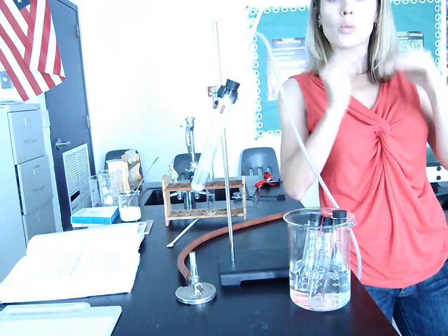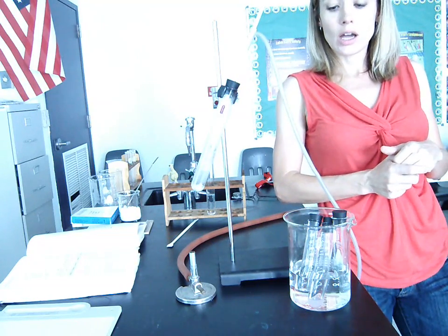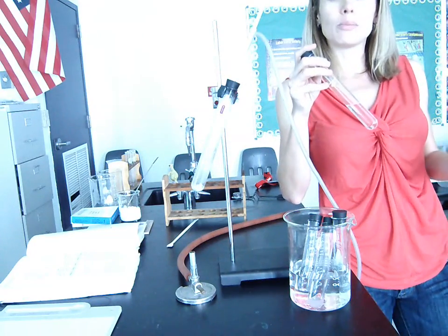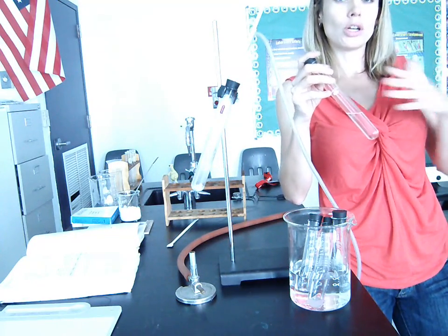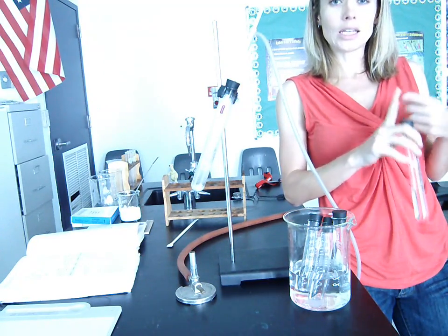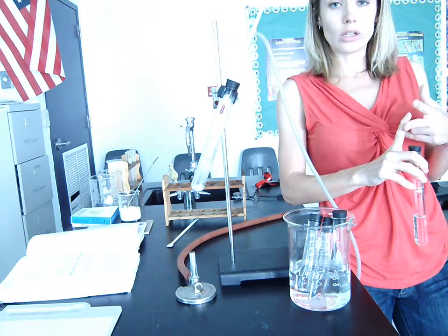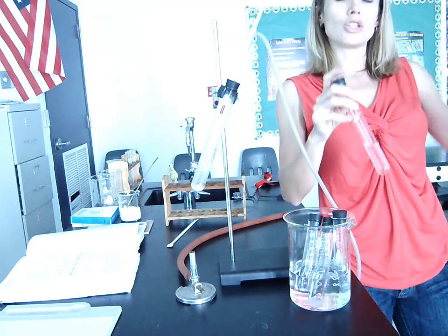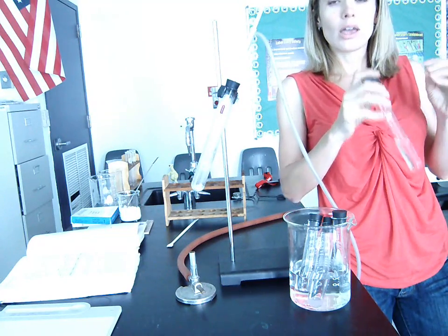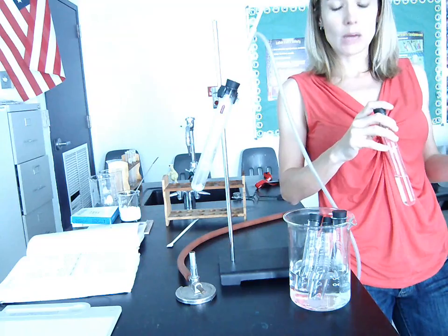Before, the book calls for us to actually test the liquid initially to figure out what the two boiling points are. If we took this liquid and did a boiling point graph, taking the temperature over time, we would see that there's two distinct boiling points. One of the boiling points is around 80, and the other is around 100. That would be the original step, so that we could figure out what the boiling points are before we actually separate the liquid.